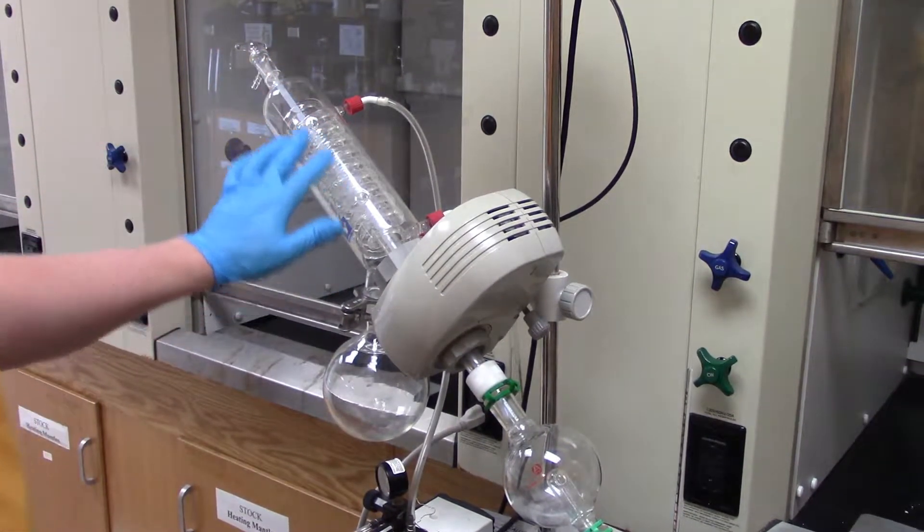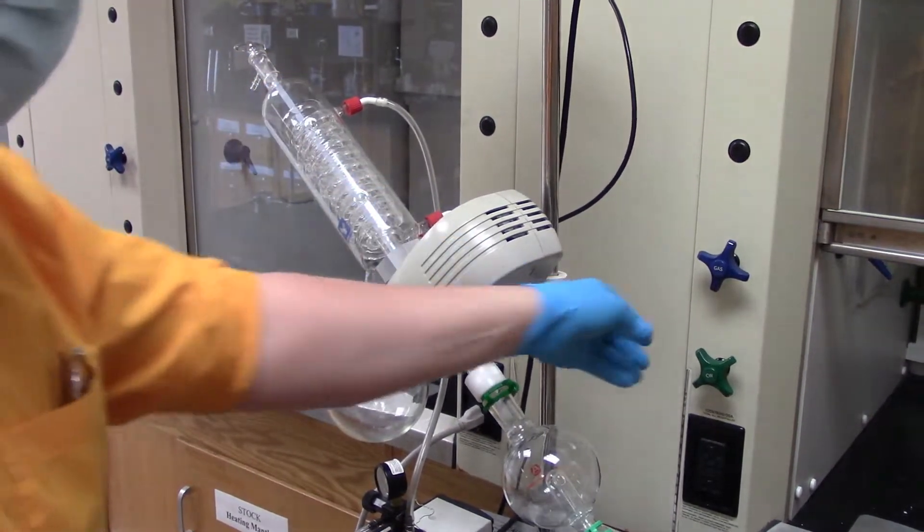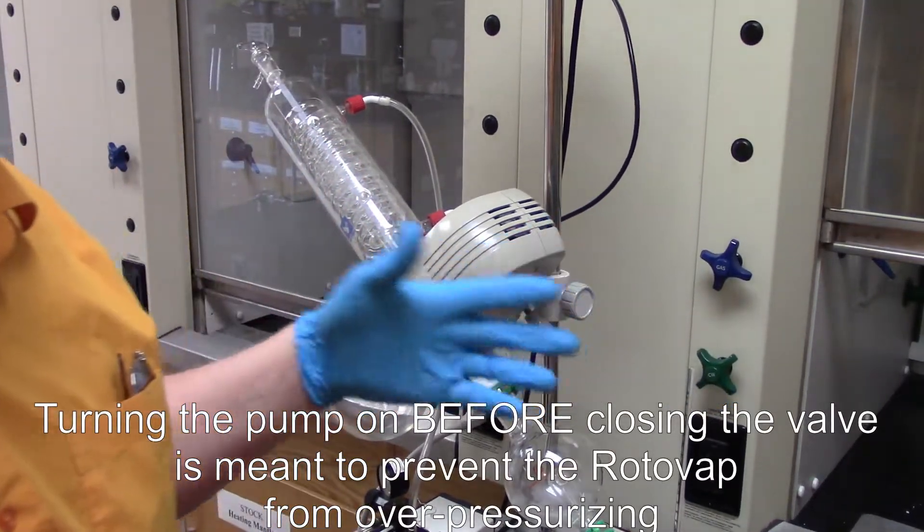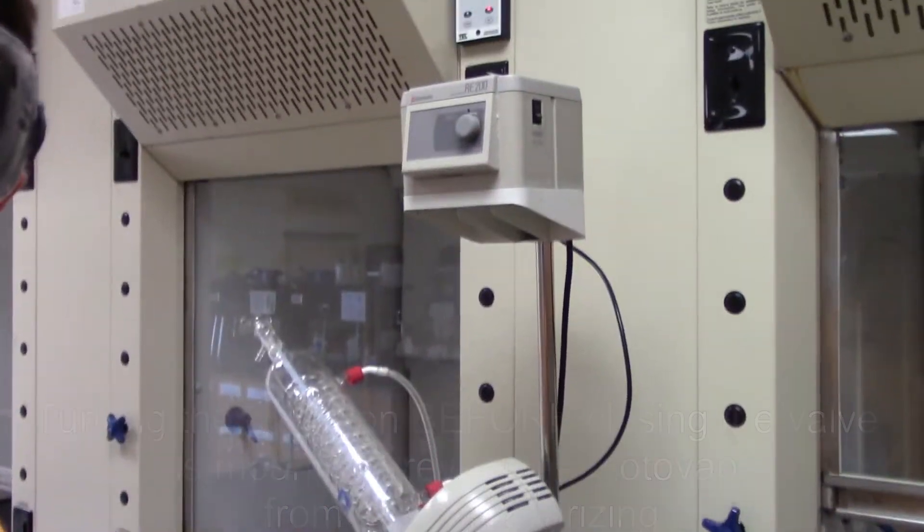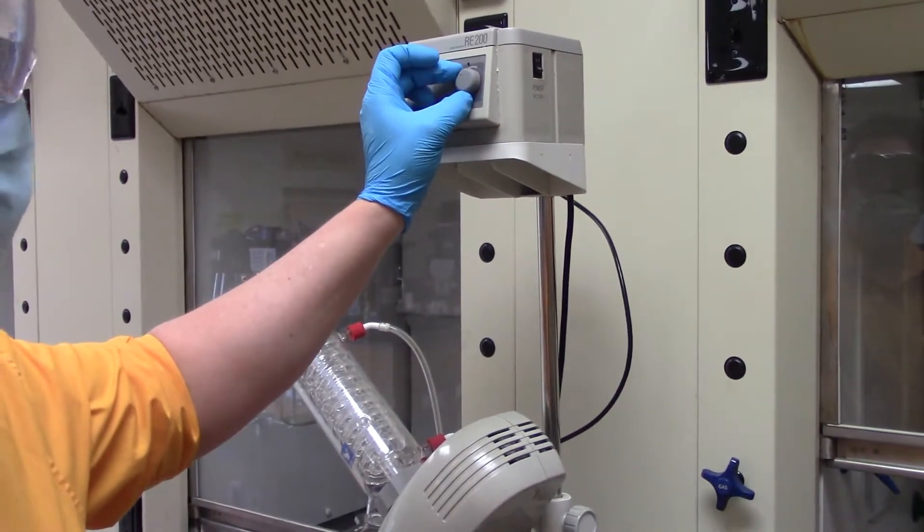Seal the container. Now, I turn the pump on first with the valve open on the off chance that perhaps the pump cycles backwards on its first loop. This basically guarantees that we don't build pressure. And then I'm going to turn the rotation here to about 11, 11.30.